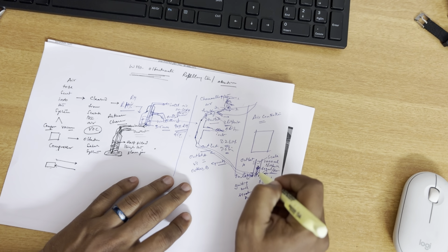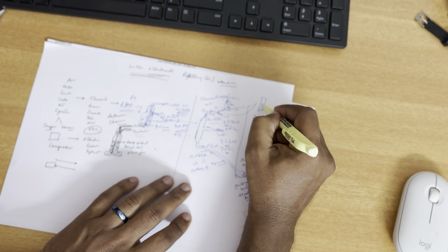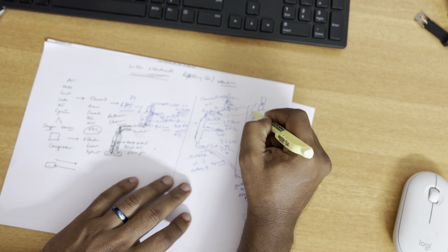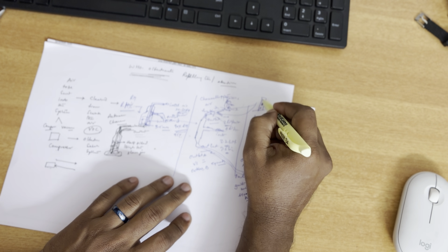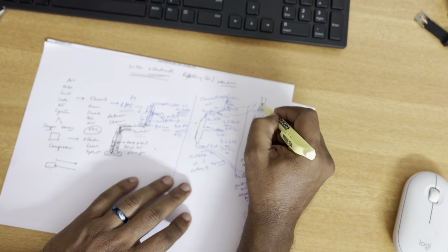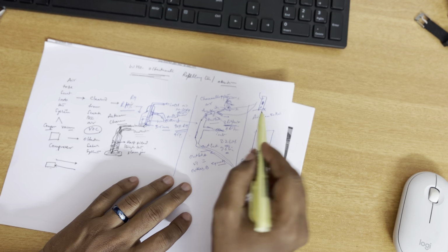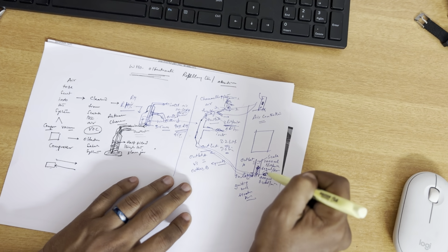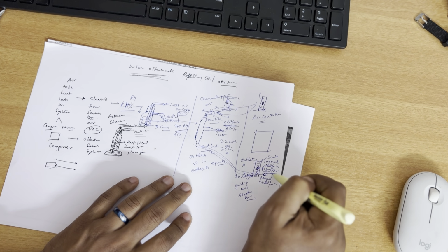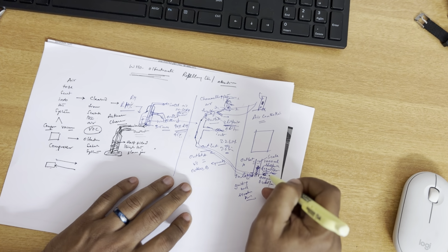So you're going to do the same thing here by sending it to the air controller. You're going to set the ball at the center so that the air coming inside is regulated to the level where we need it. Like earlier it was coming at 3 liters per minute as input, but when we set it up, if you wanted to have 600 ml per minute, the output air will be exactly 600 ml per minute.